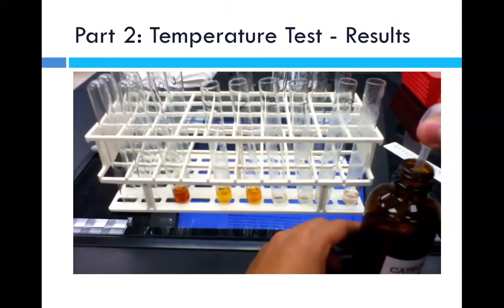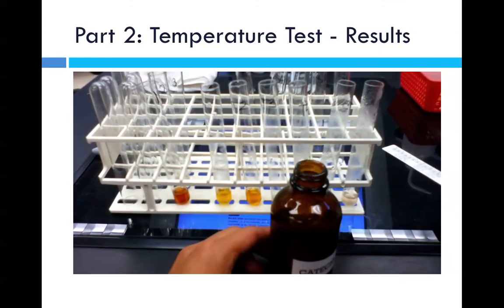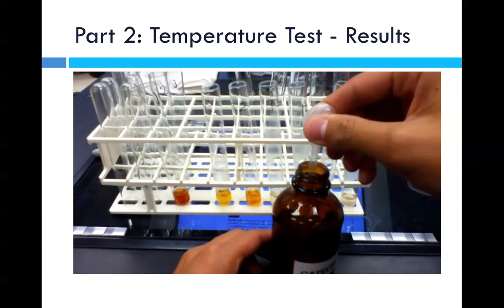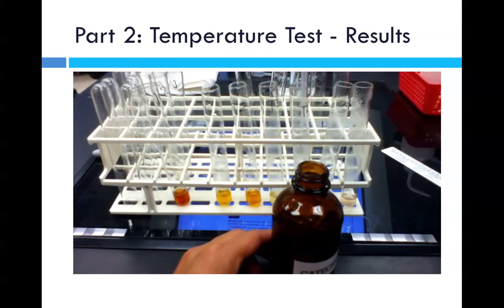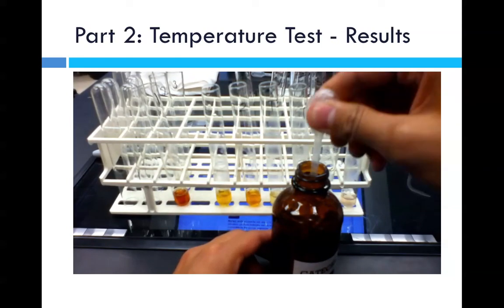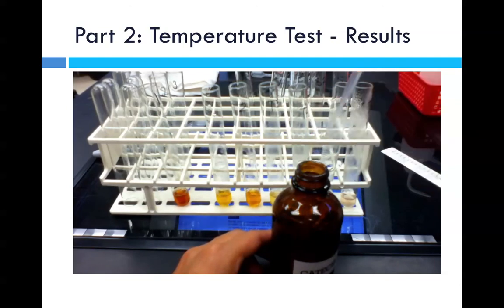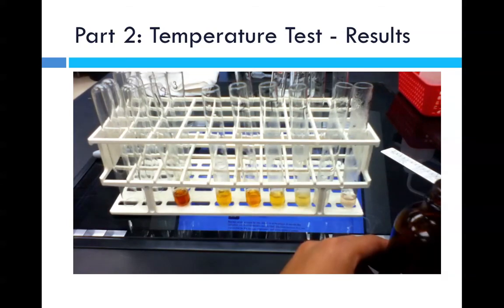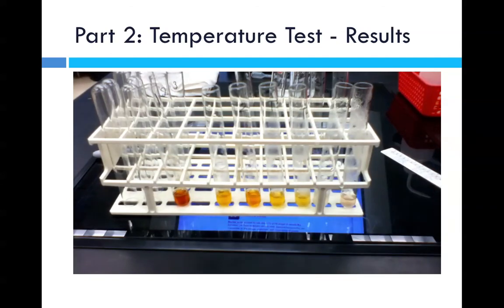Here we have a video of me adding the catechol into our test tubes. As you can see, I didn't get it from the very beginning, but as I pour the 1 milliliter of catechol into each test tube, there is coloration, which means that there is some reaction of catechol based on its environment. And though it's just initial, over time the catechol and catechol oxidase continue to react and provide a brighter color.